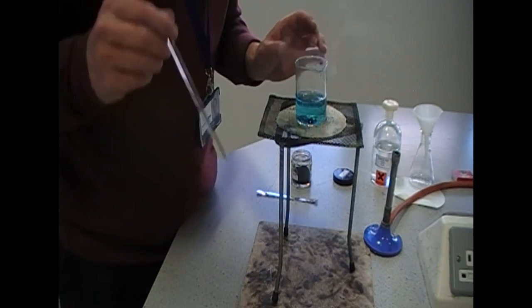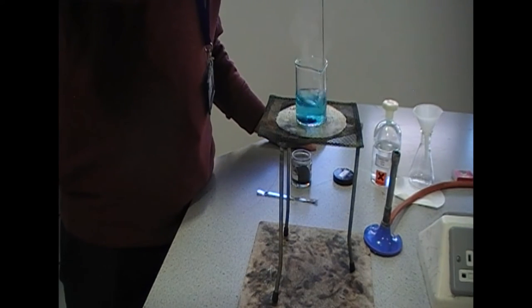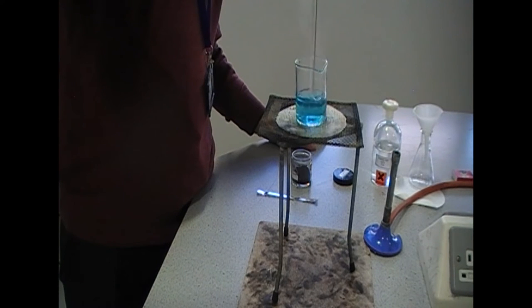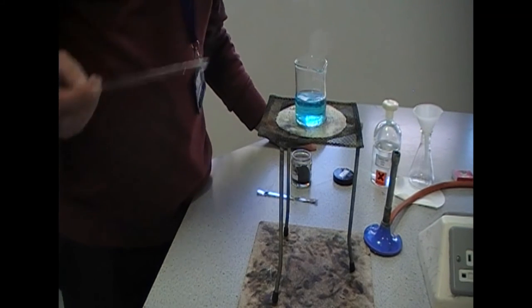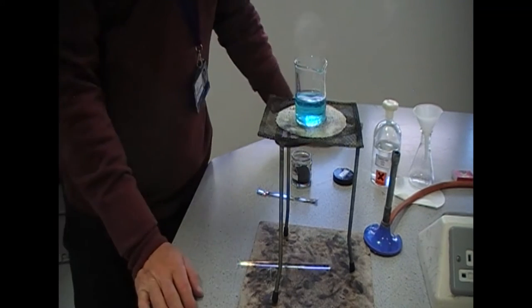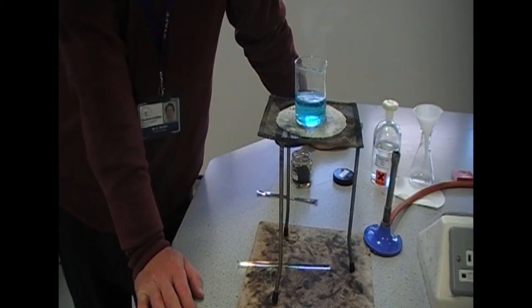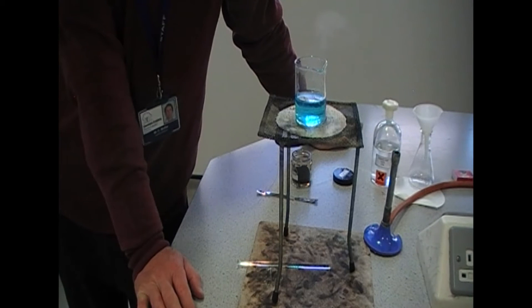But when you look at the bottom of the beaker, there will be unreacted black powder. If I stir there, that unreacted black powder soon disappears like so. And the solution has gone clear blue.